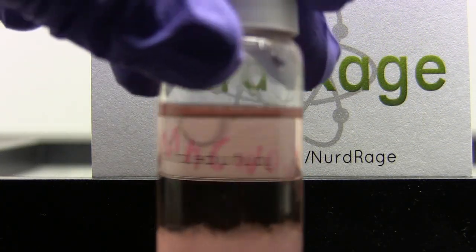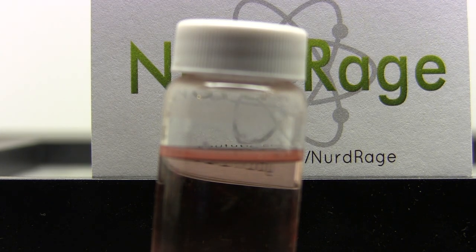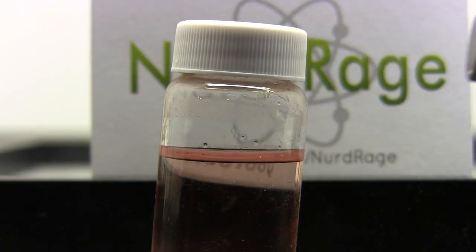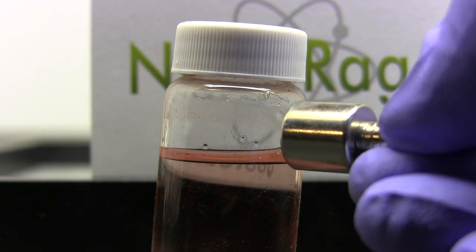Moving on, here I have a saturated solution of manganese nitrate. We can see it's ever so slightly attracted to the magnet and creeps up along glass.